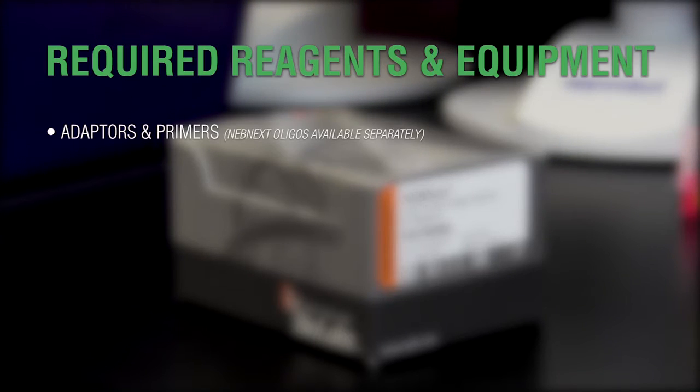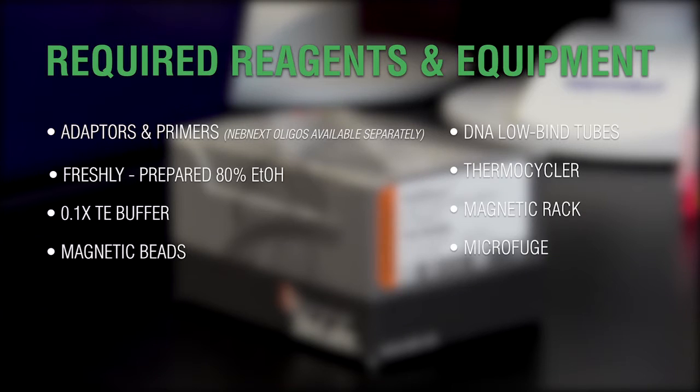Before you begin, you'll want to make sure that you have available all of the required reagents and equipment that are not included in the kit.